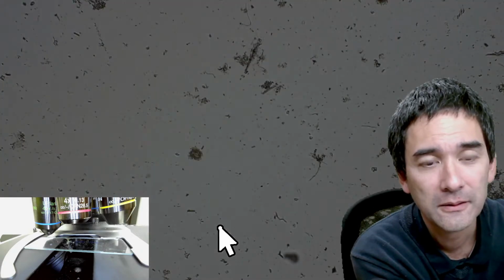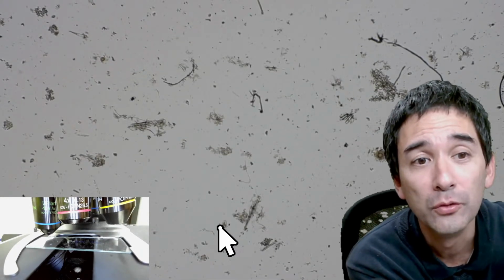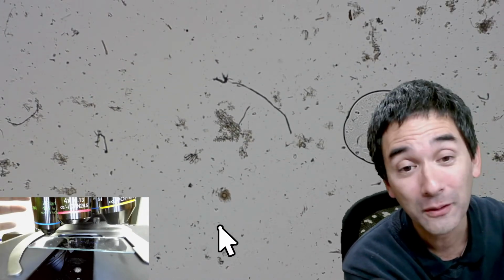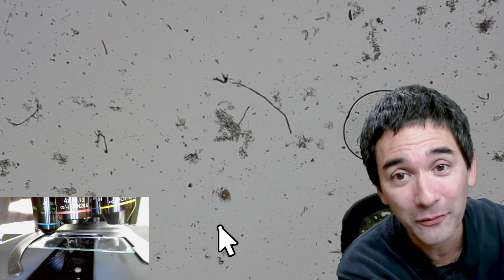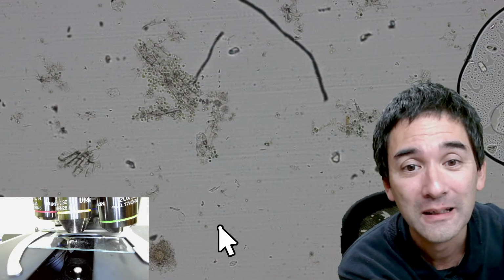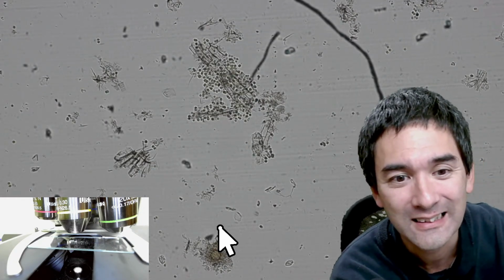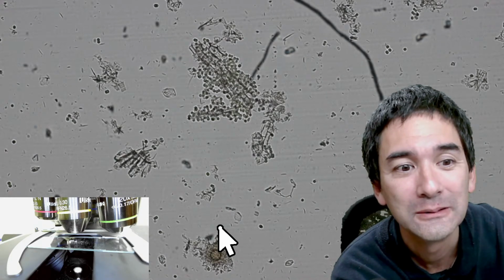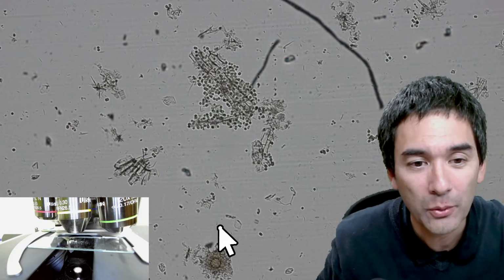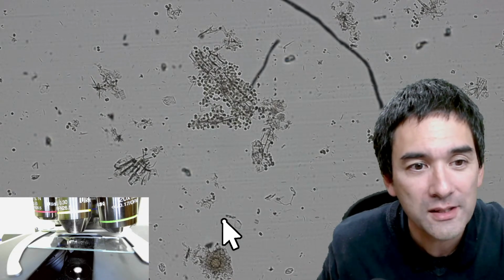The light. So, yeah, I don't see any movement. Looks pretty dead. Or all of the cells and all of the organisms are kind of squeezed in. Do you see those horizontal stripes? Yeah, I didn't clean it properly enough. But it doesn't matter. I'm just trying to demonstrate this here. By the way, I now also have an arrow that I can use for pointing at objects.